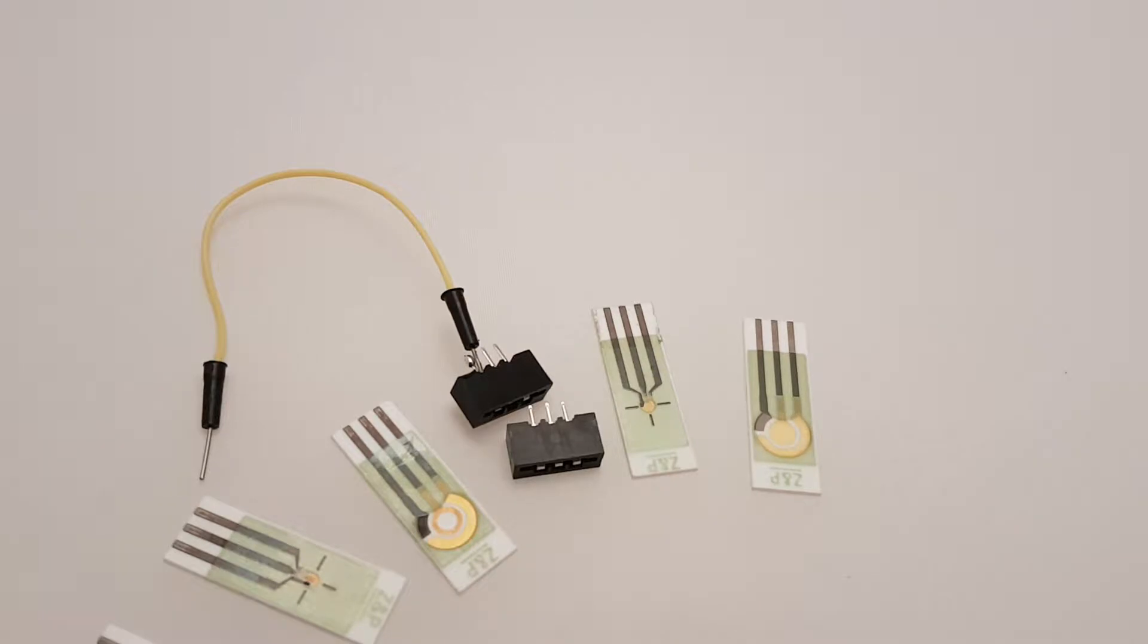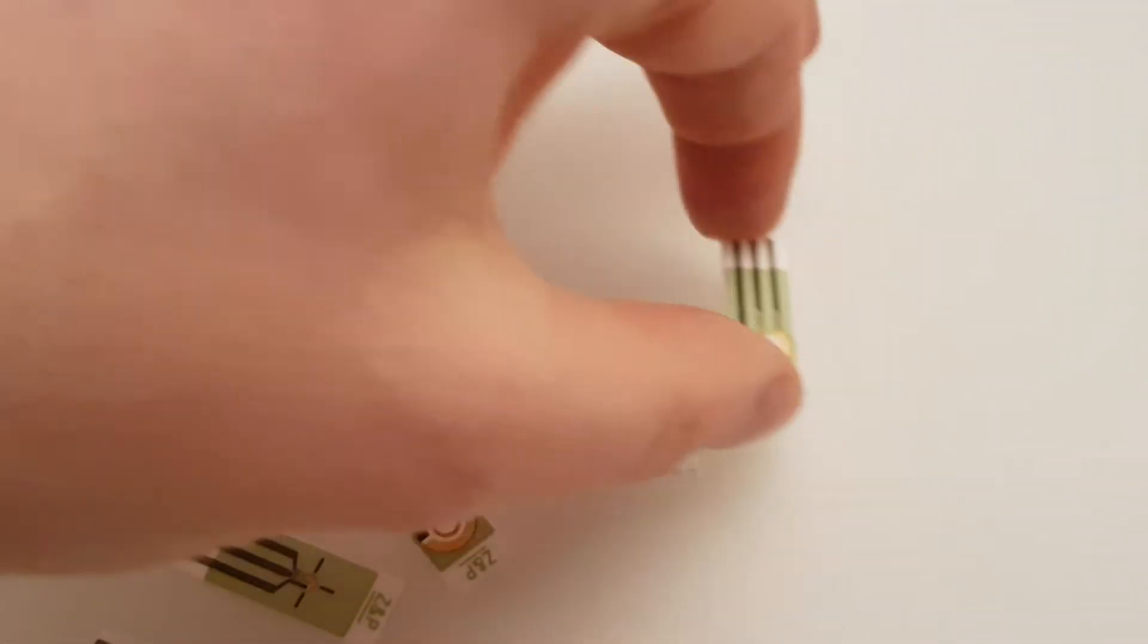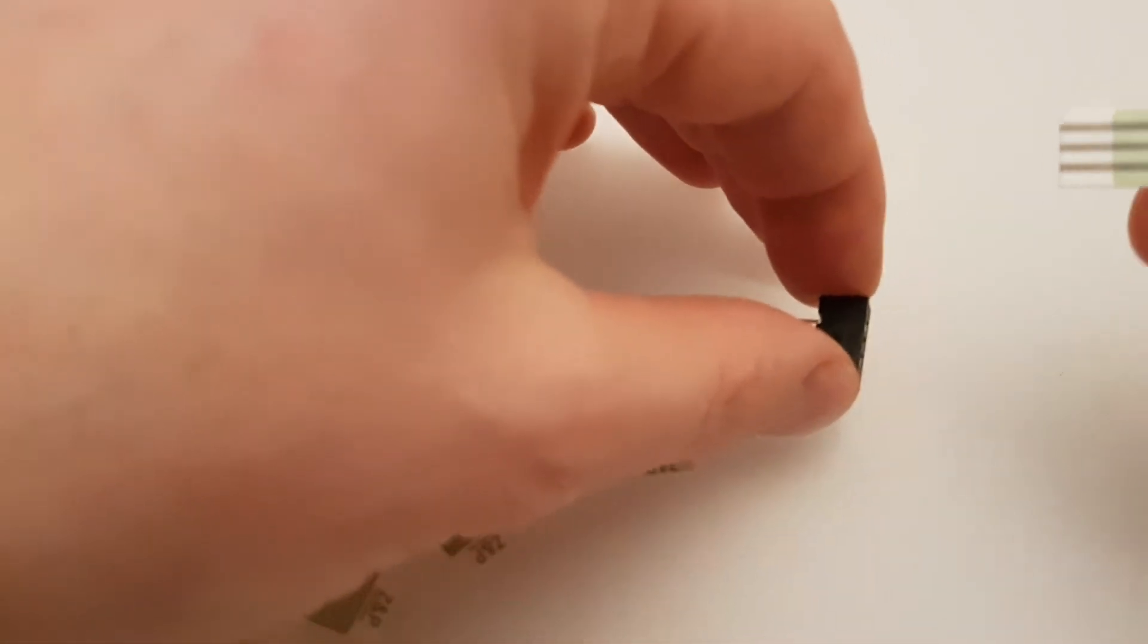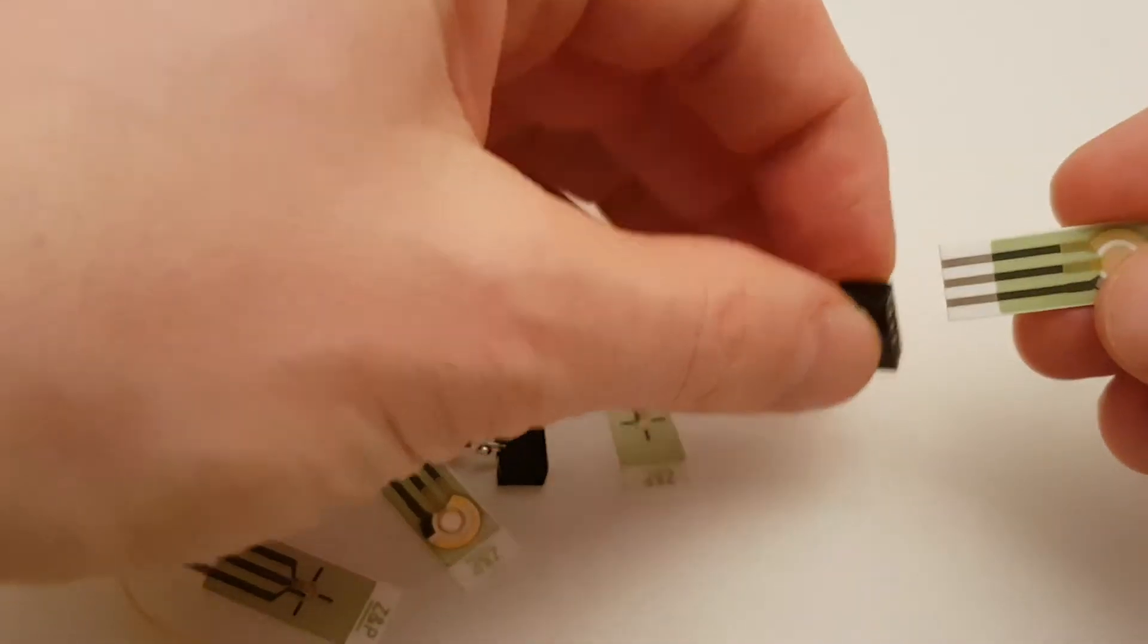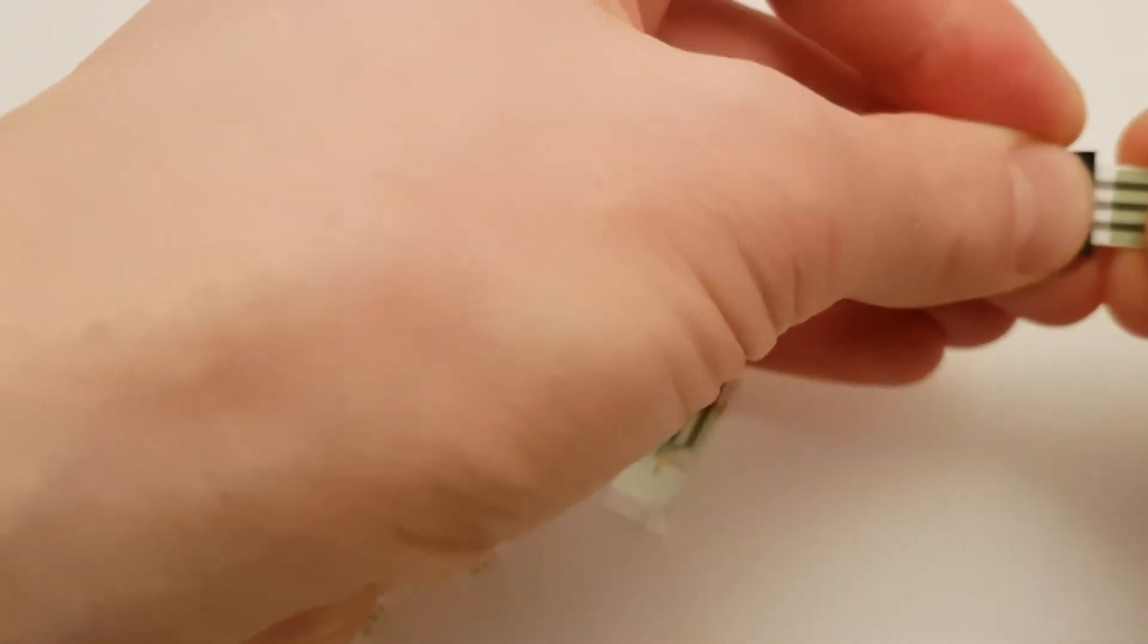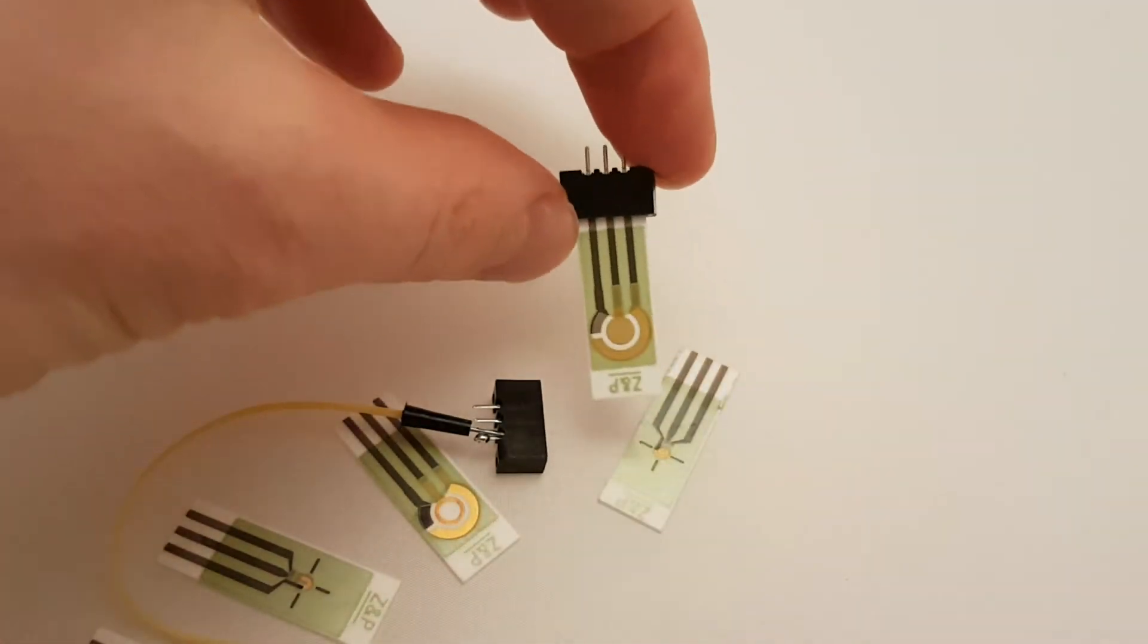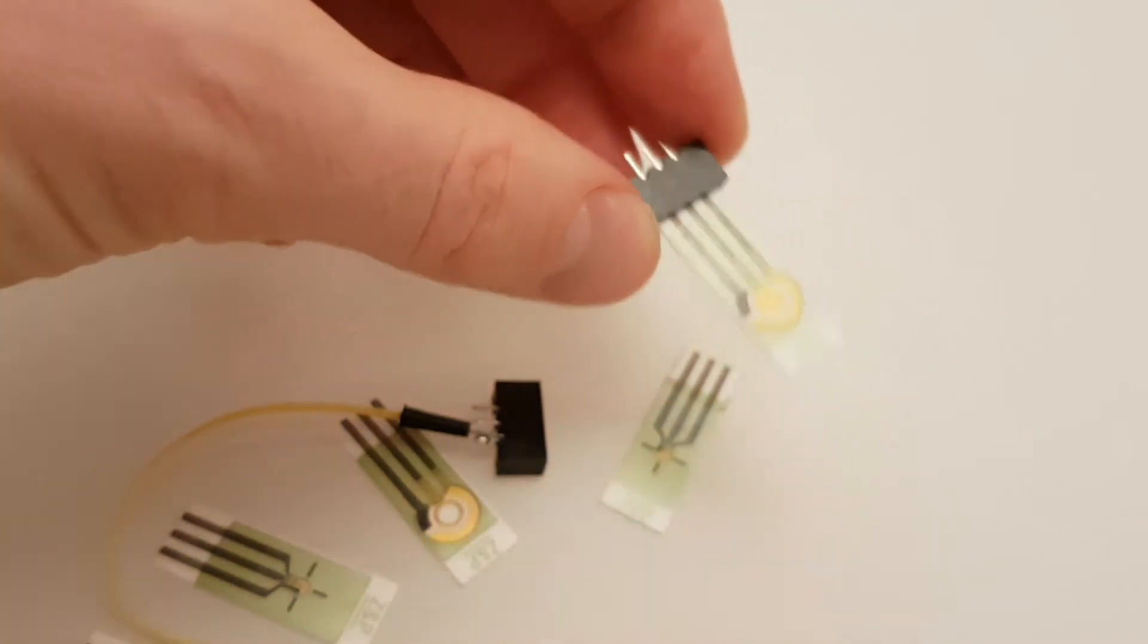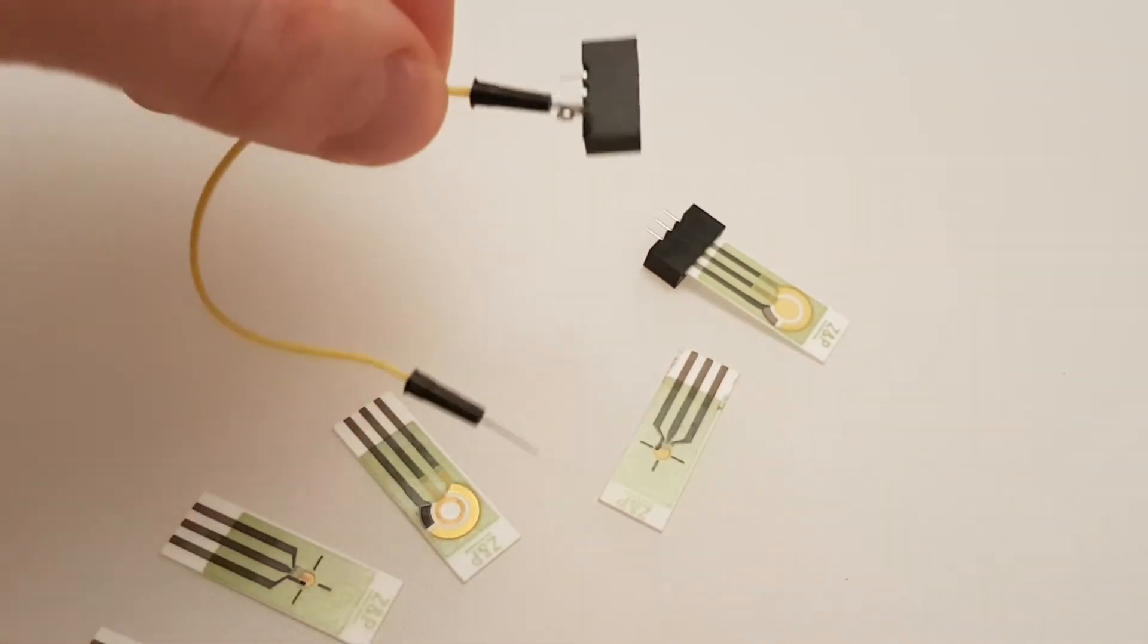It's quite simple really. We have connectors and basically just connection like that. So now that makes a nice robust electrical contact.